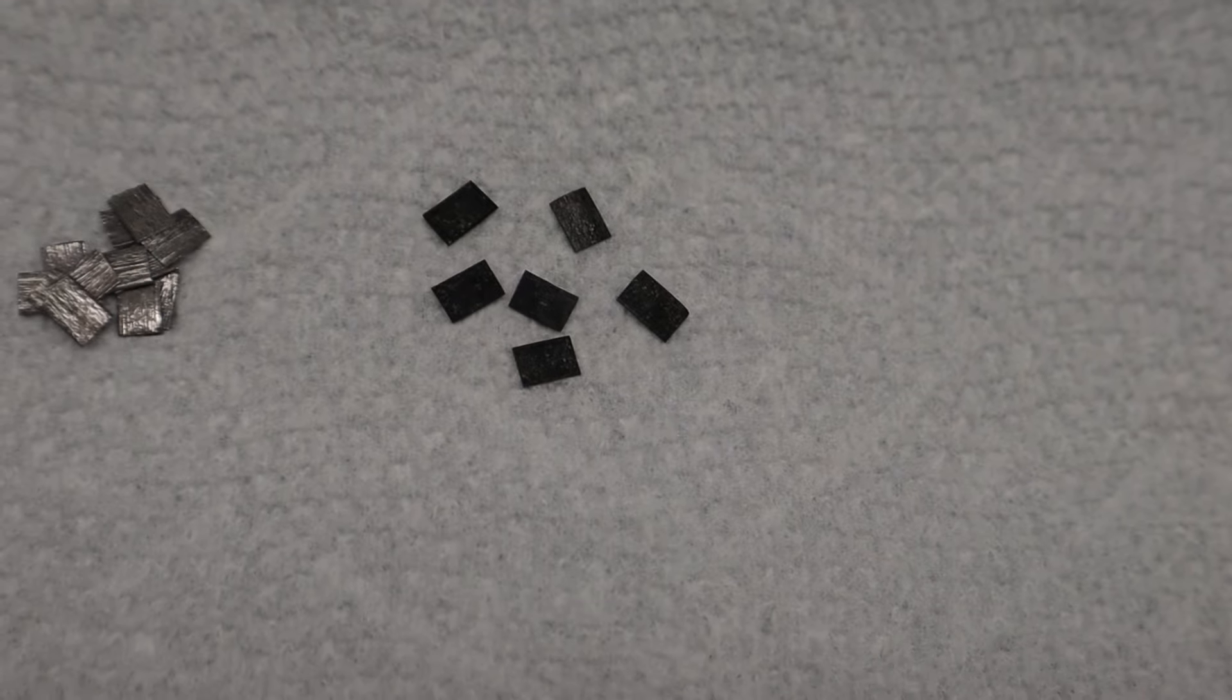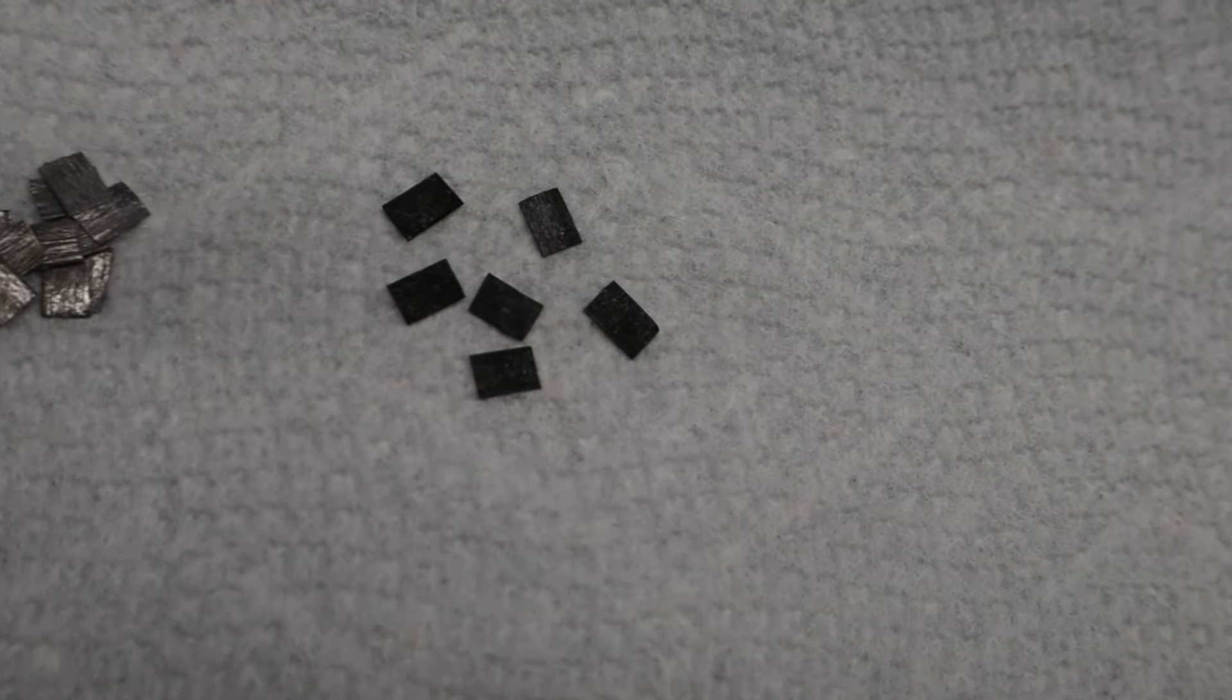But you can see one of these here—that one there—you can see it's not coated quite as well as the others.